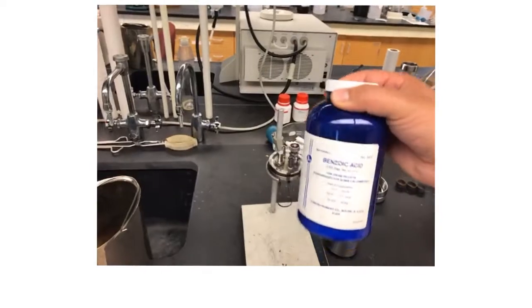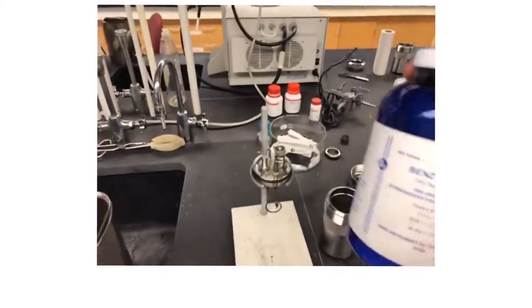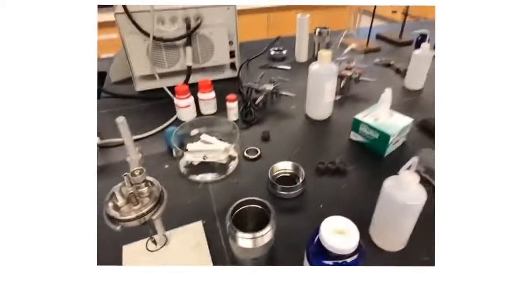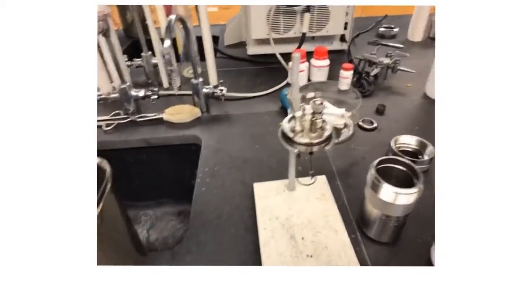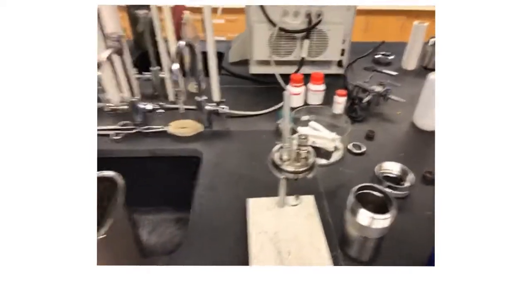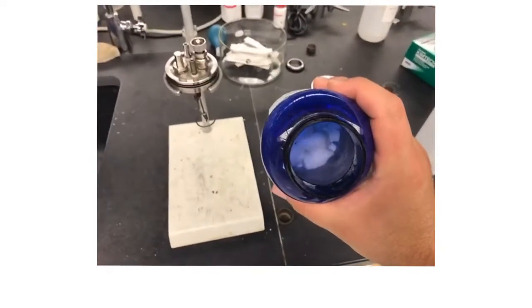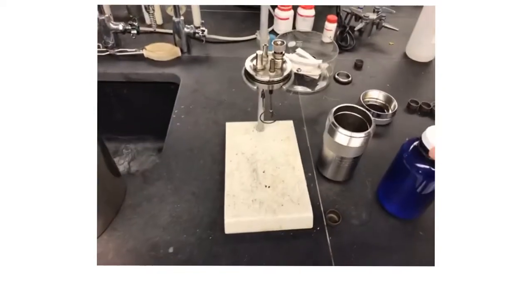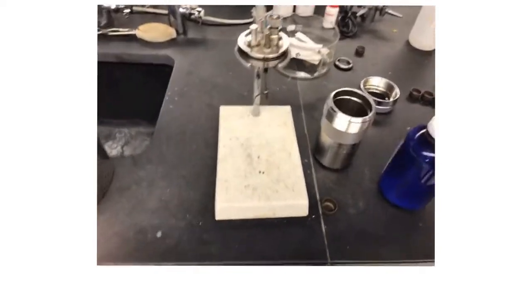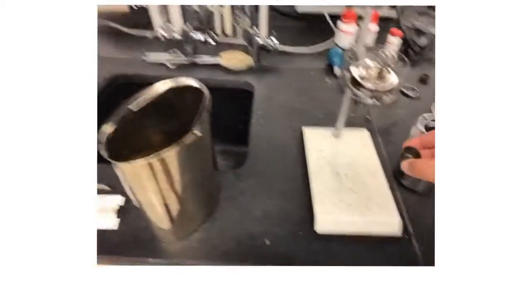We have some pre-made benzoic acid samples. There's also a smaller white bottle that looks pretty similar. If you take a look in here, you see there's some capsules of benzoic acid in terms of pre-made pellets. So that's convenient for adding one of those pellets here.